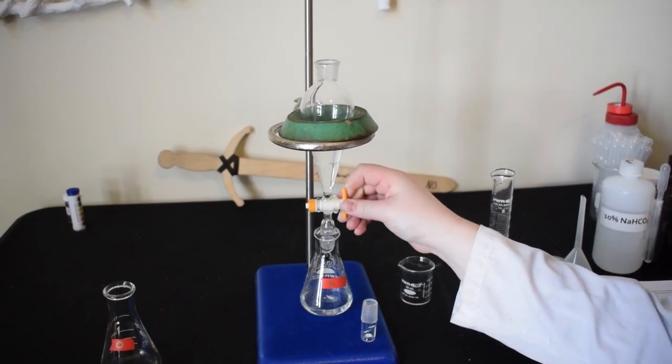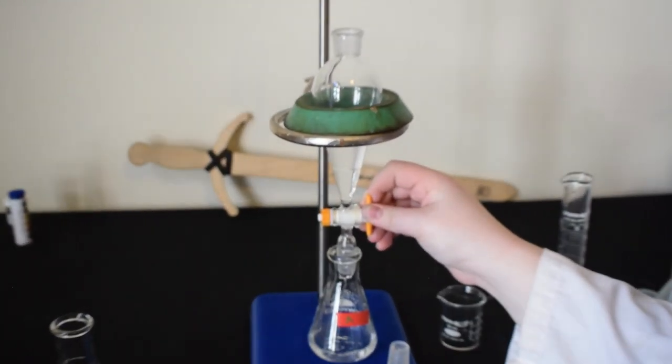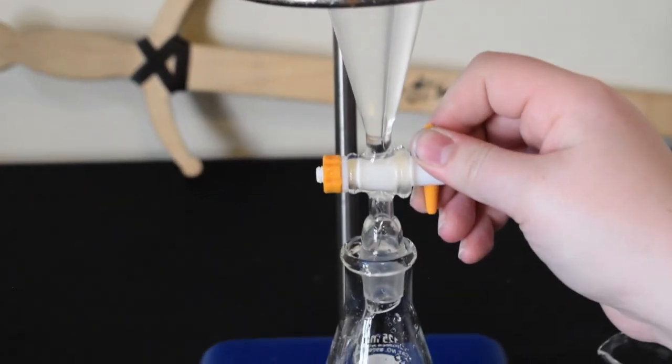We are draining the bottom aqueous layer into the same aqueous flask from earlier.